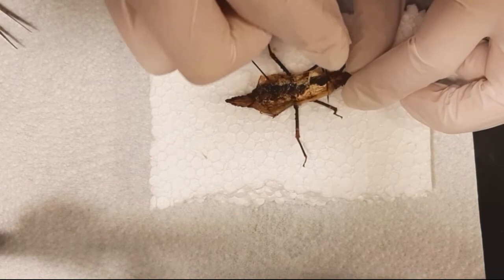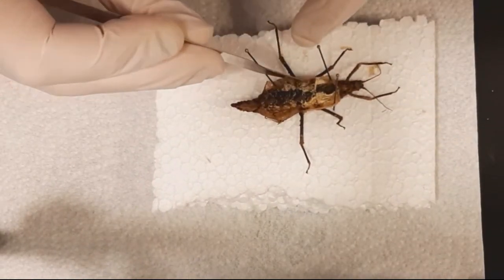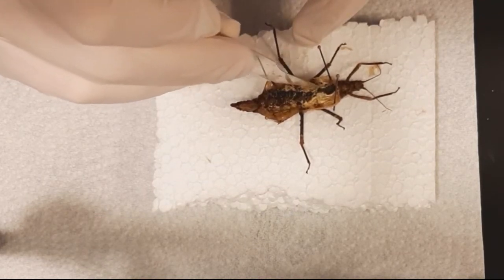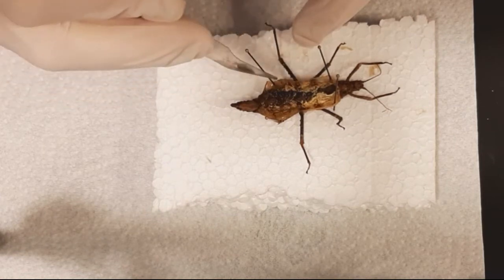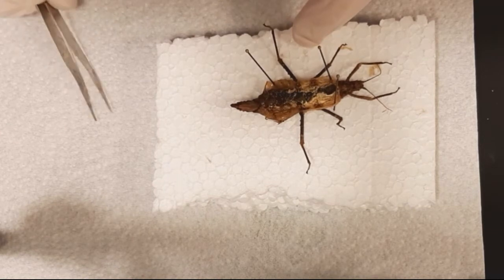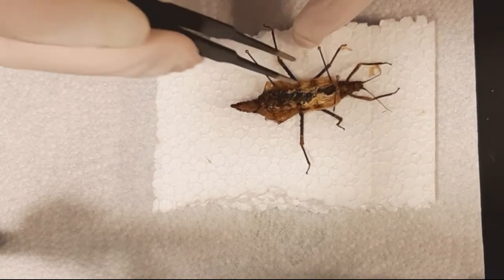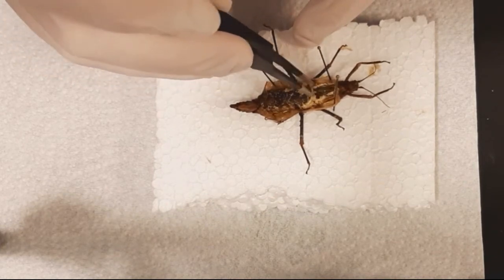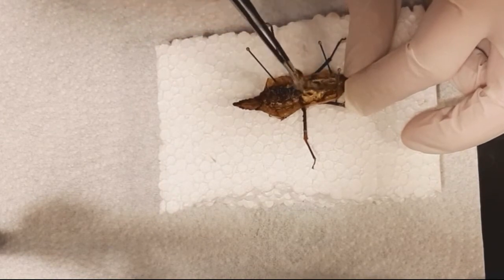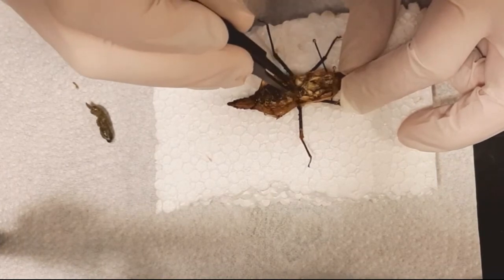For study I prefer the method of cutting open on the side of the specimen and folding it open with your fingers, some weight, or tweezers, and keeping it open like that. Here you can see all the inner workings of the insect — the organs, the connective tissue, the eggs, the muscles, the nerves, and some more tissues that are barely visible. The nerves are even barely visible in smaller specimens.